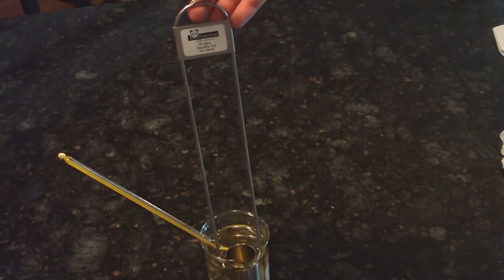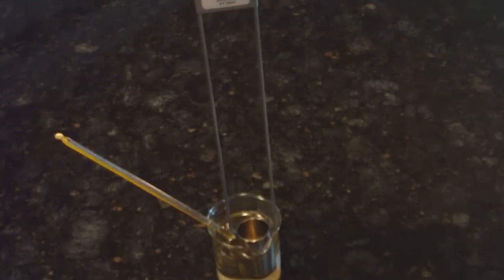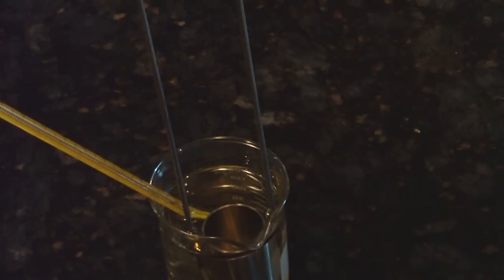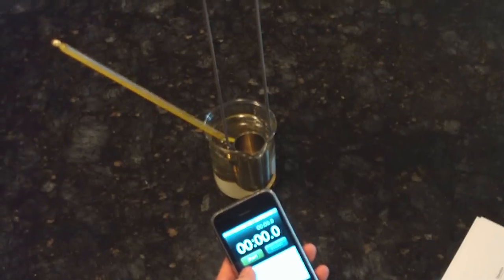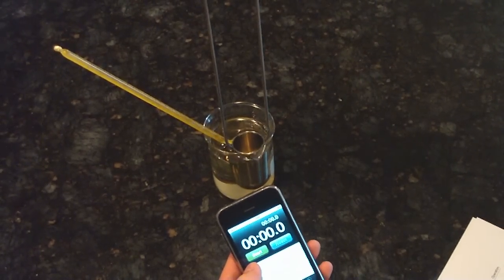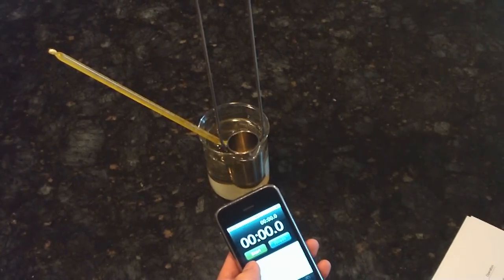First you want to go right below the surface and you need to have a timer ready. In a steady motion, pick it straight up no more than 6 inches above the cup.